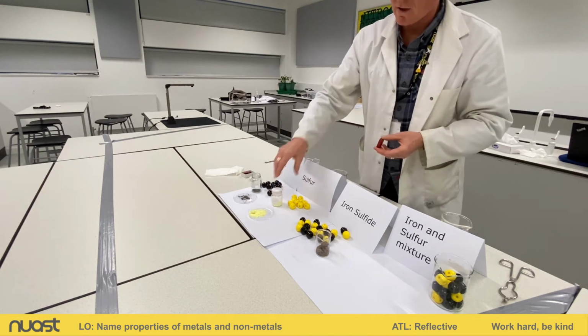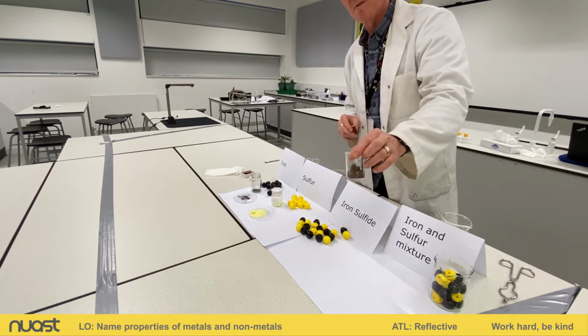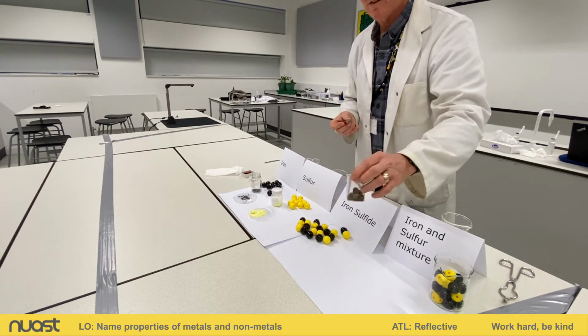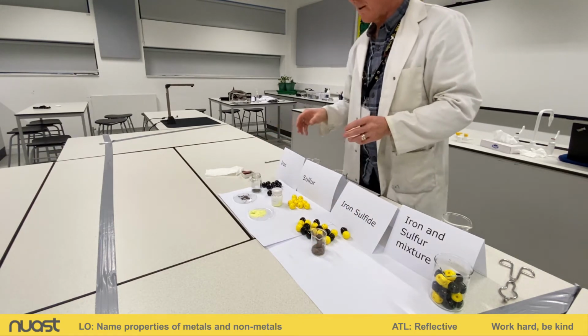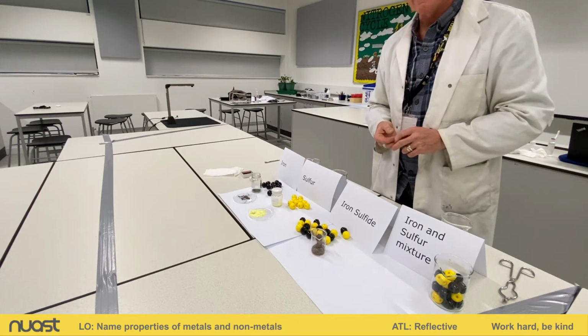Our sulfur is a nice, bright yellow solid, and our iron sulfide is a brown, this almost looks like mud solid. All right, now let's see what happens with a magnet. No, nothing happens there. So iron sulfide, all right, is not magnetic. So even though the iron and sulfur have come together, all right, to make the iron sulfide, it is not magnetic.